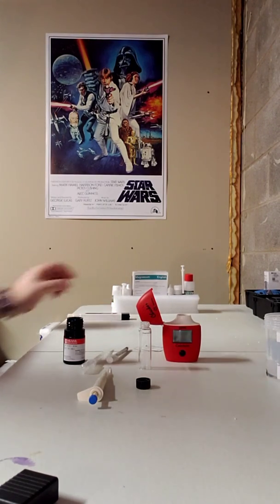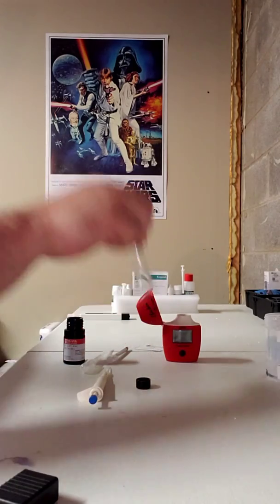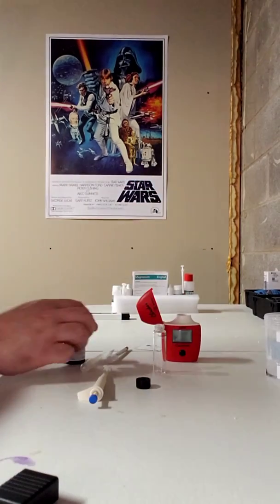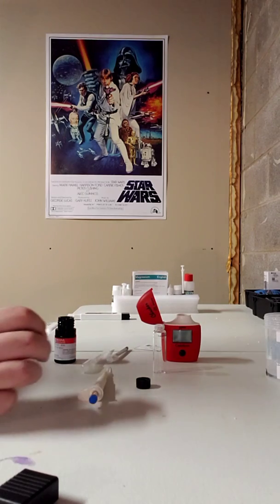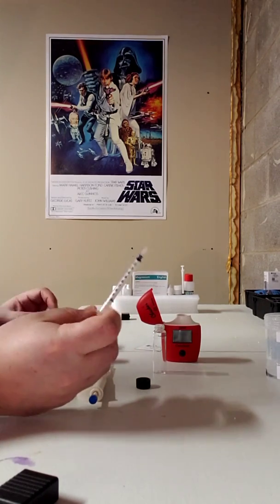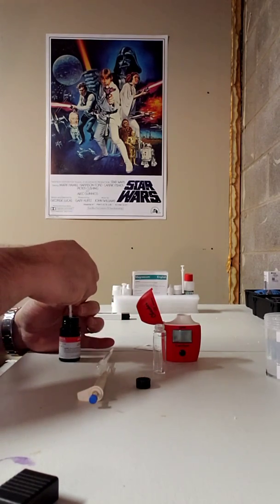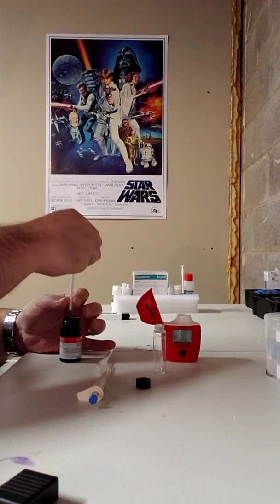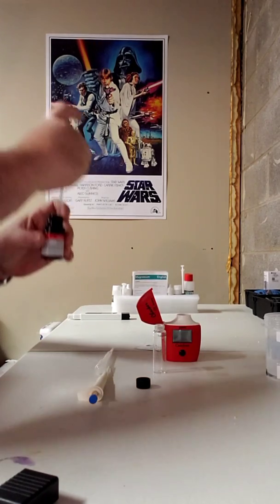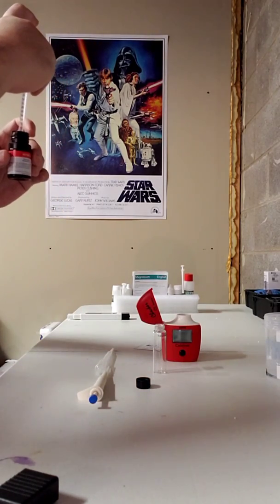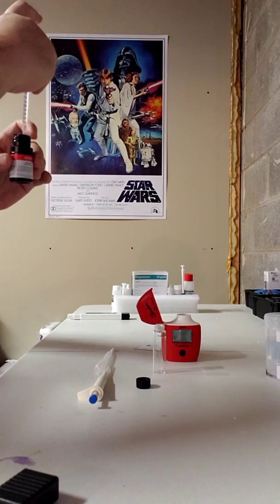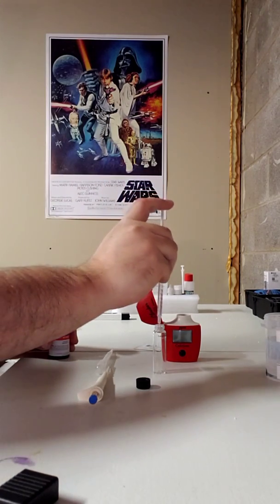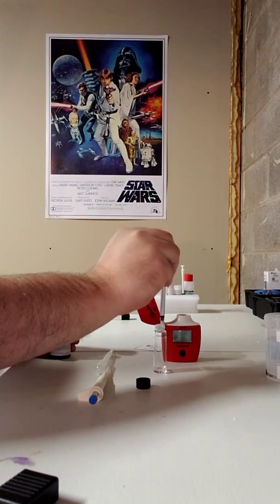Alright, so the first step, the instructions tell you to do is add 1 ml of your liquid reagent to the vial. So I'm going to take my 1 ml syringe, fill it up to 1 ml, and in it goes.